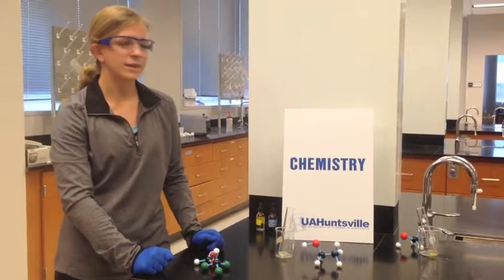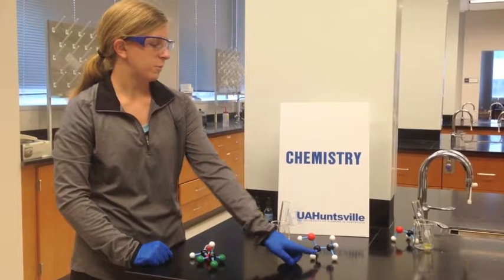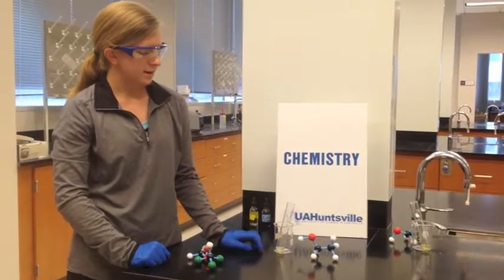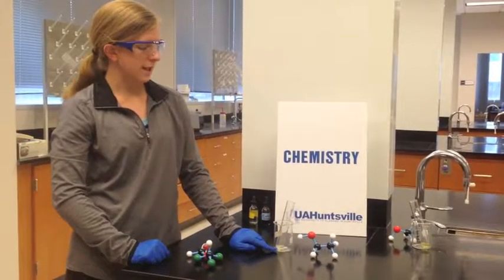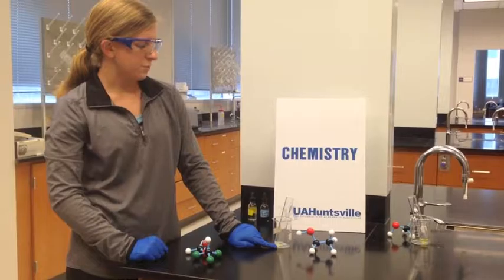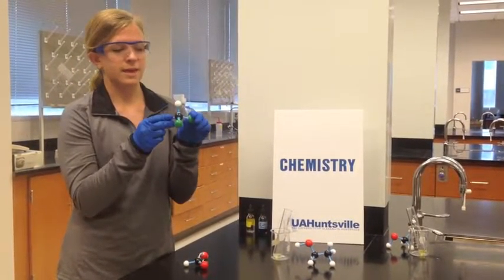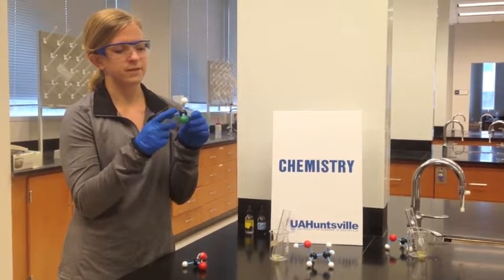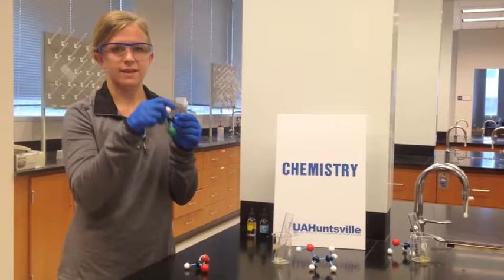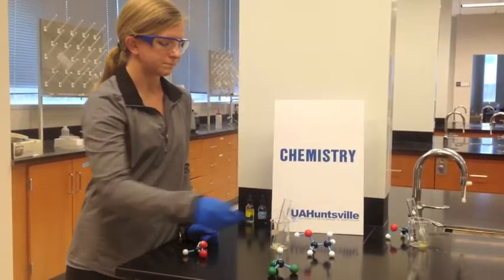Okay, so let's take a look at a visual representation of what we just said. So remember, we started with ethanol, which is this molecule over here, and we reacted it and got iodoform and the formate ion. So we said that this yellow precipitate in the bottom is the iodoform, or triiodomethane is the IUPAC name. So that means that there's one carbon in the middle, three iodines around it, and then that's the hydrogen on the top. And remember, this is tetrahedral geometry.